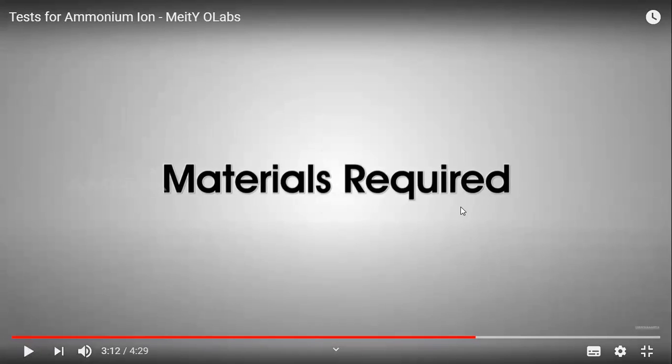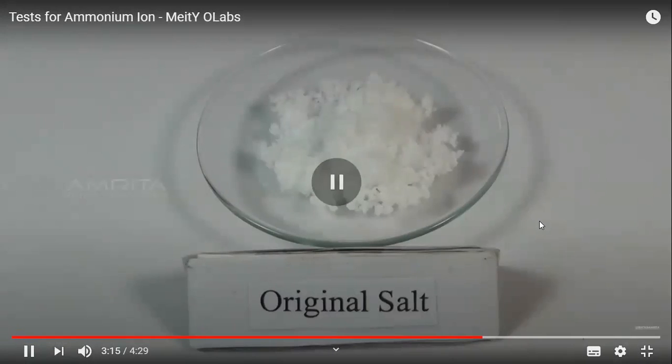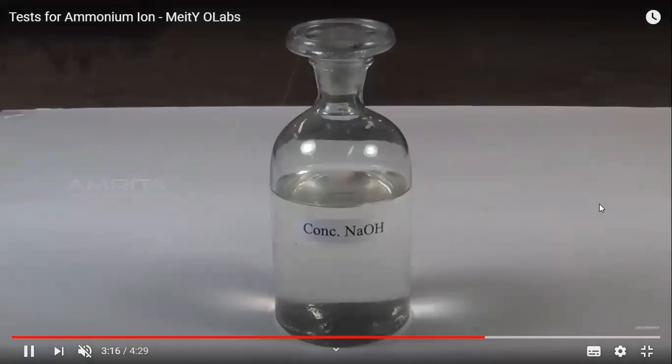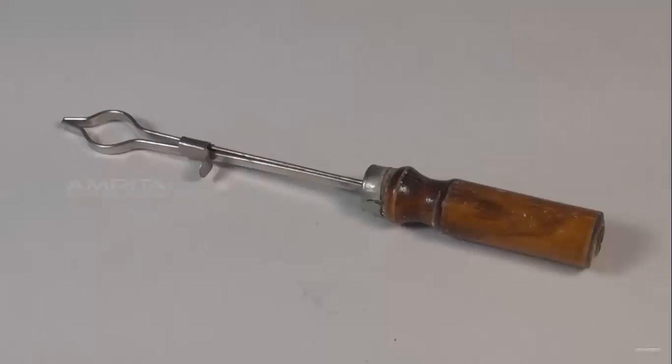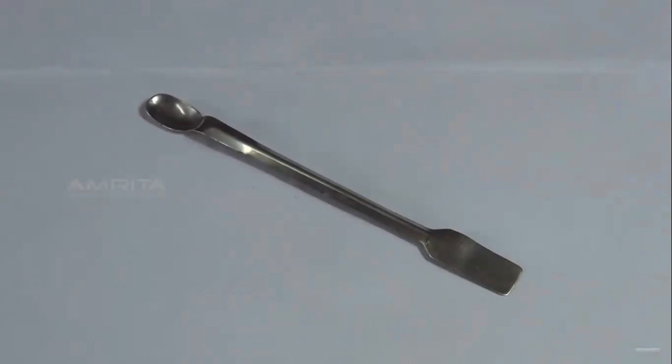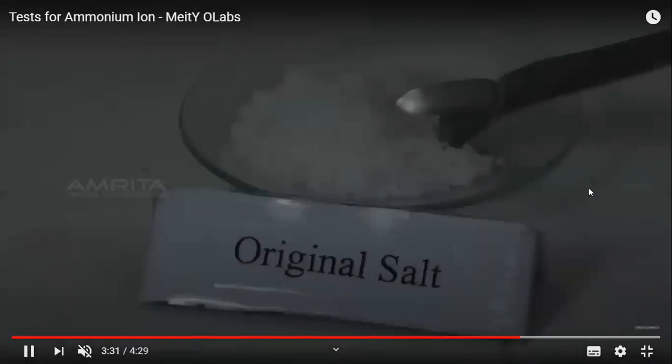For Nessler's reagent test, we first need the original salt, then we need concentrated sodium hydroxide, Nessler's reagent, test tubes, a test tube holder, a spatula, droppers, and a Bunsen burner.